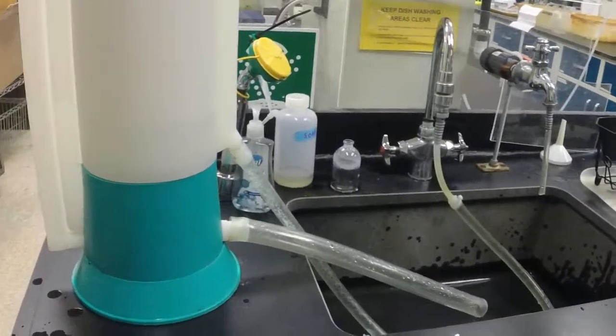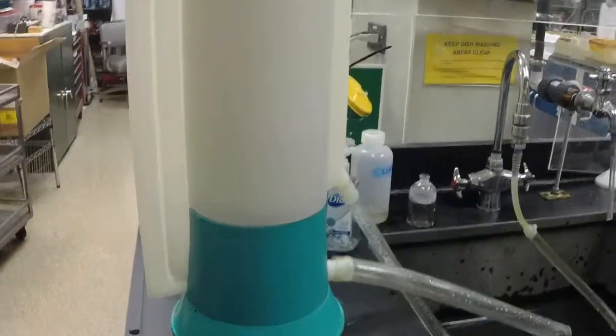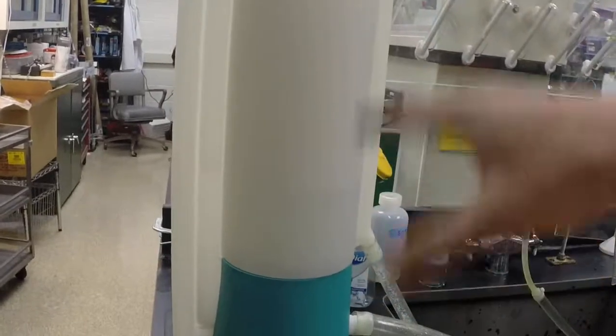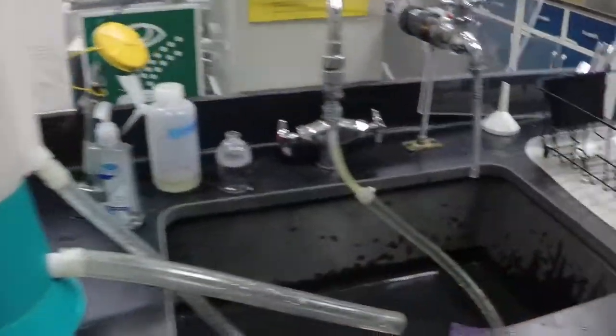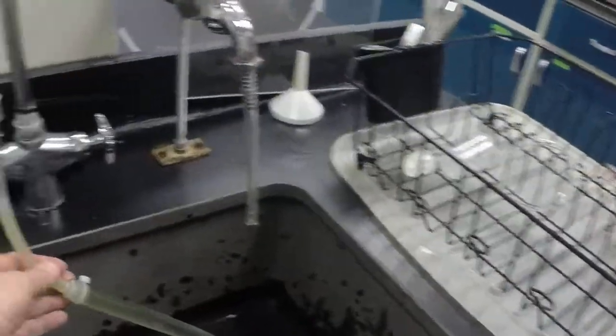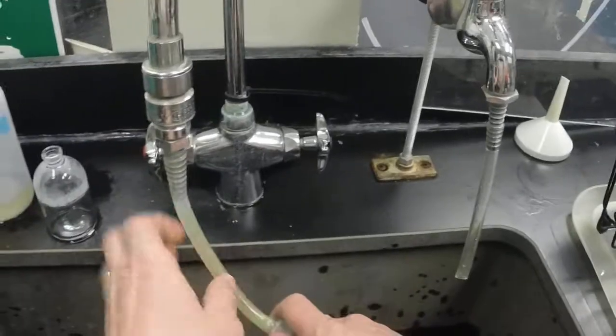This will happen as long as you leave the water running. You have to keep in mind that with hot water, run it through half a dozen times. Once we have it good and rinse all the soap out of there, then what we'll do is actually then unattach that and turn it off.